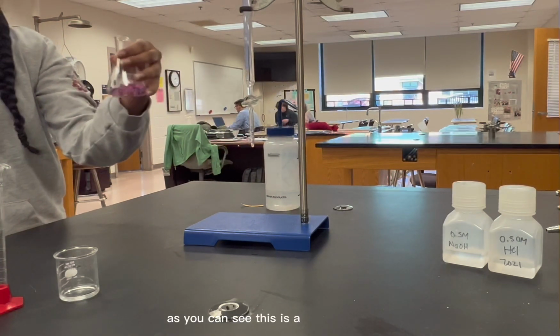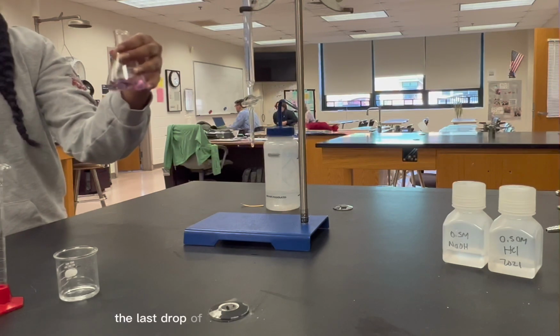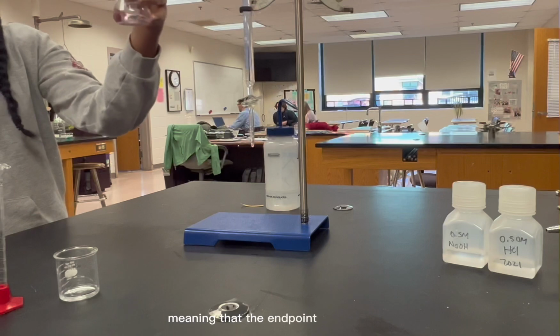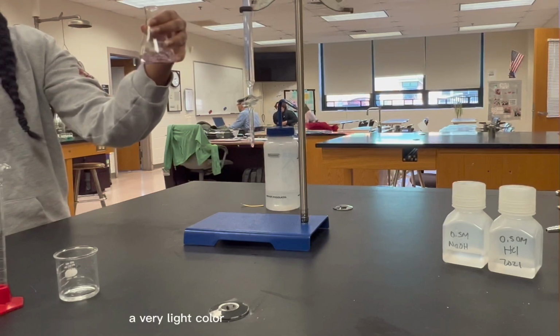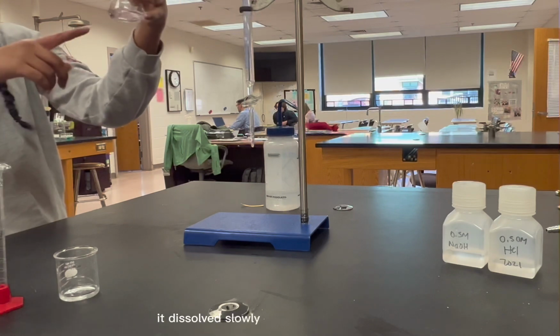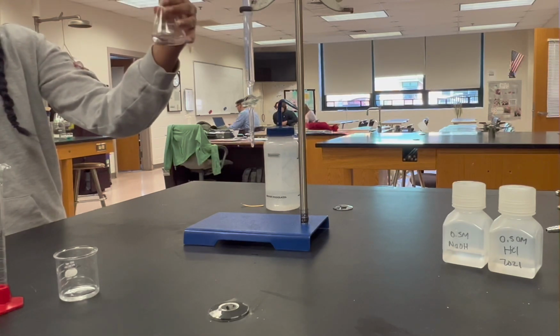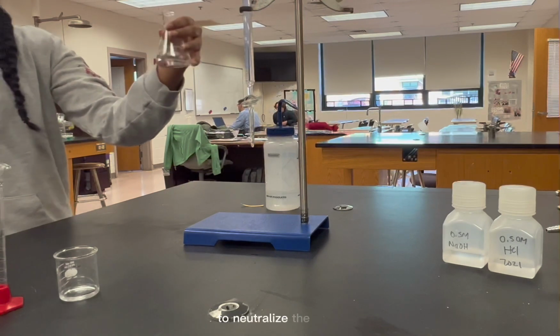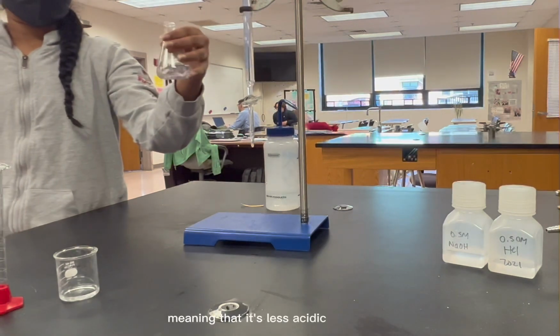As you can see, this is a perfect titration. The last drop of NaOH took around 20 seconds to dissolve, meaning that the endpoint was reached. A very light color was formed, and then after mixing it, it dissolved slowly and turned back to clear. Indeed, it took around 7 drops of NaOH to neutralize the Polar, meaning that it's less acidic than Sprite.